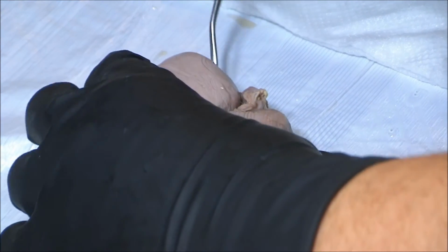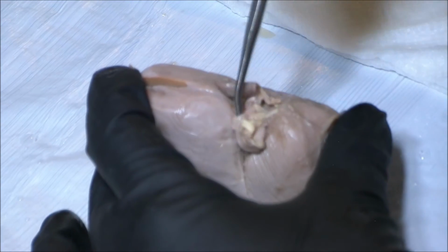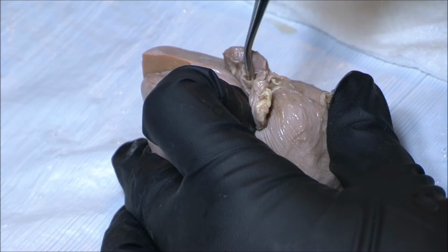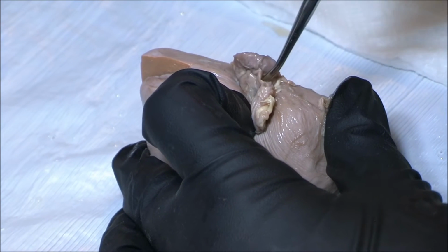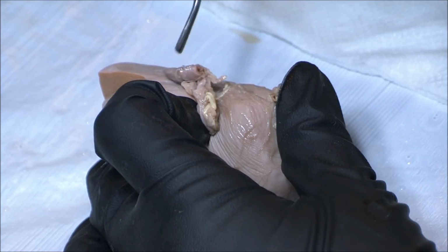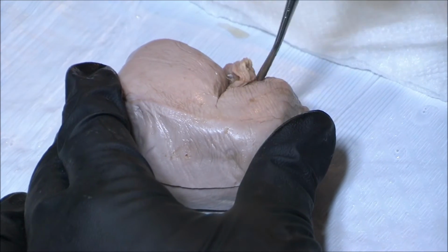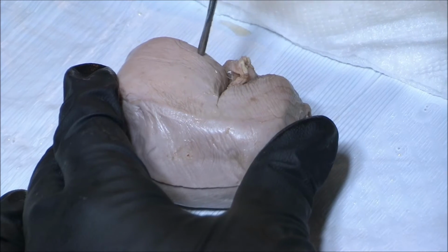There's a series of tubes. The first tube, the large tube coming from the bottom, is the ureter. Above that is the renal vein, and it collapses as it has the thinnest walls. And above that we have the renal artery. These tubes all come out of the hilum, which is a recessed or concave area, the medial side of the kidney.